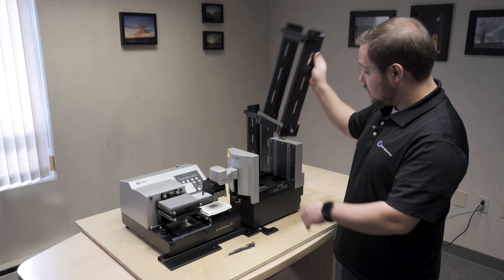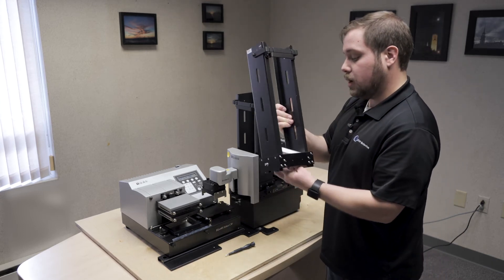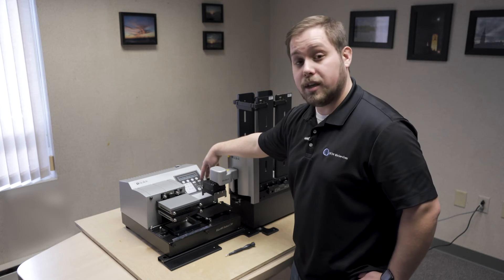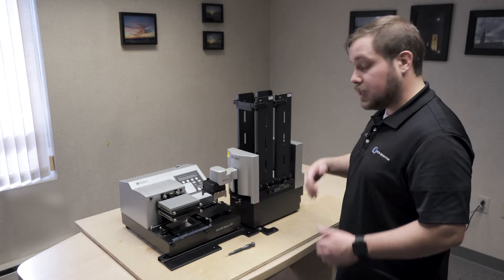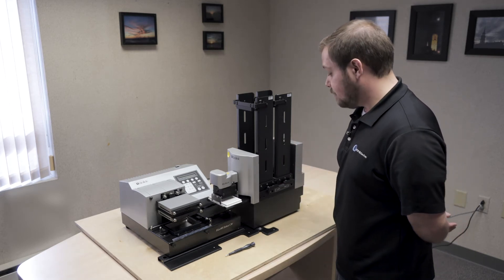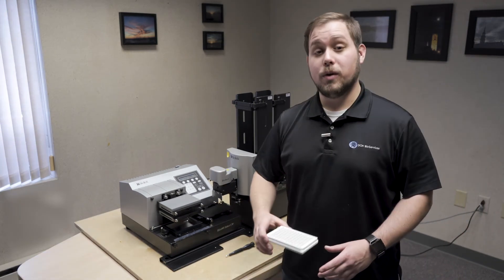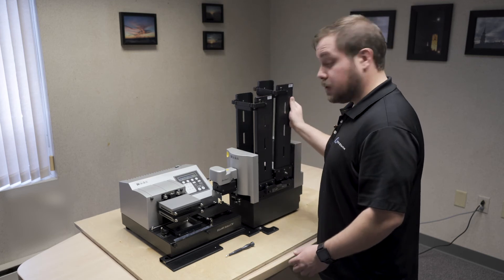At this point, we'll need our plate stacks — both the output and the input. We'll take our test plate, load it into the input, and lock them down. Here we'll use the verify utility. Confirming that a plate is on the in stack, the stacker itself is going to load a plate and attempt to place it on the plate carrier for the washer. If we've done everything correct at this point, it'll place it perfectly and we'll be able to reload back into the output stack. As you can see, we had a slight jump there, so we'll need to do the alignment again. Once you've fine-tuned the physical alignment of the stacker, run one last verify just to ensure that your positioning is correct.